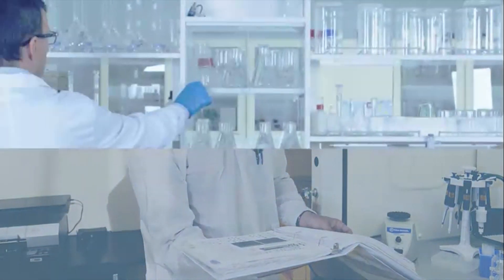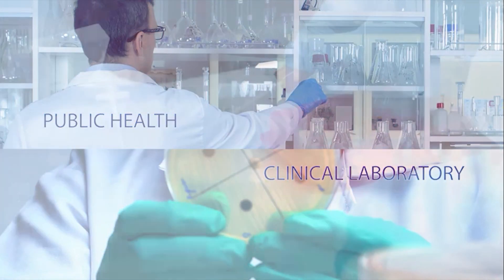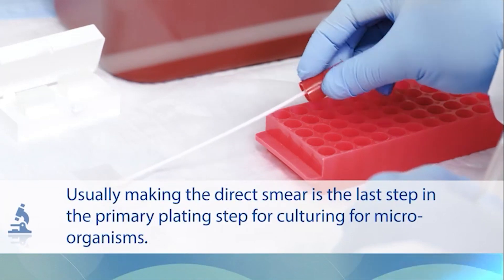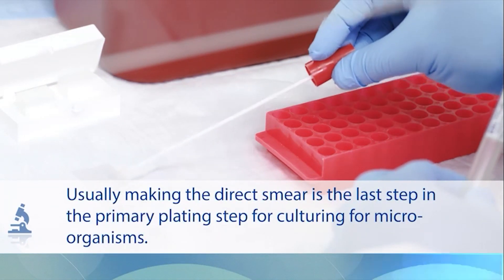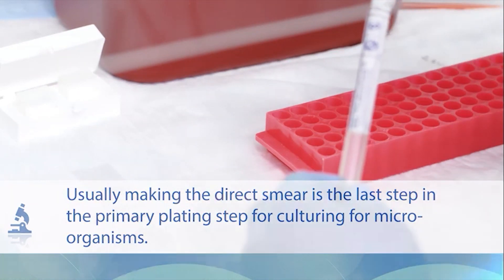In both the public health and clinical laboratory, you may need to make a direct smear from a specimen. Usually, making the direct smear is the last step in the primary plating step for culturing microorganisms.